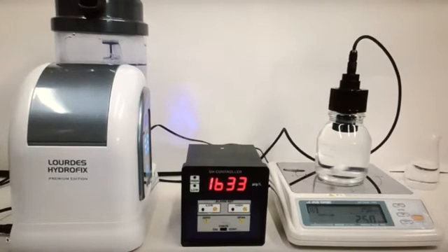I thought this was going to be really important and helpful for everybody who wants to get the most out of hydrogen and learn how to do this correctly. You can't rely on drops or checking for ozone with strips - that's not professional. This is the professional and correct way to do it. I hope you found this video helpful and are as excited as I was, because I was happy to learn this and get proper footage showing how it should be done. Japan is the only place doing it, but I think eventually people will come around.